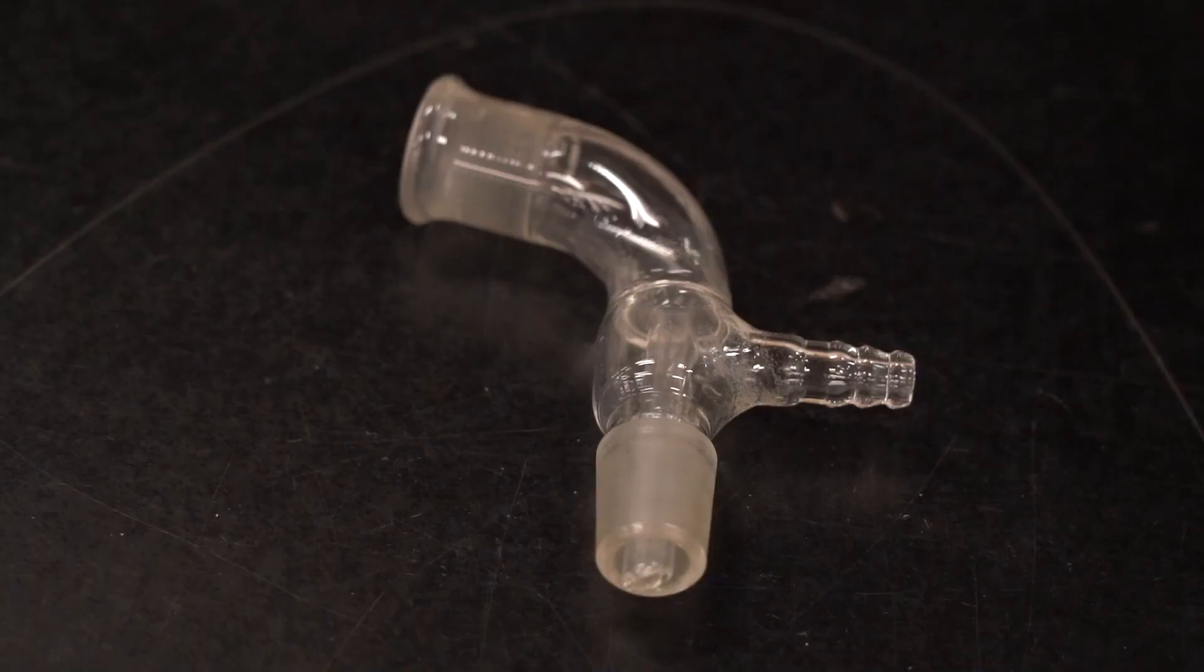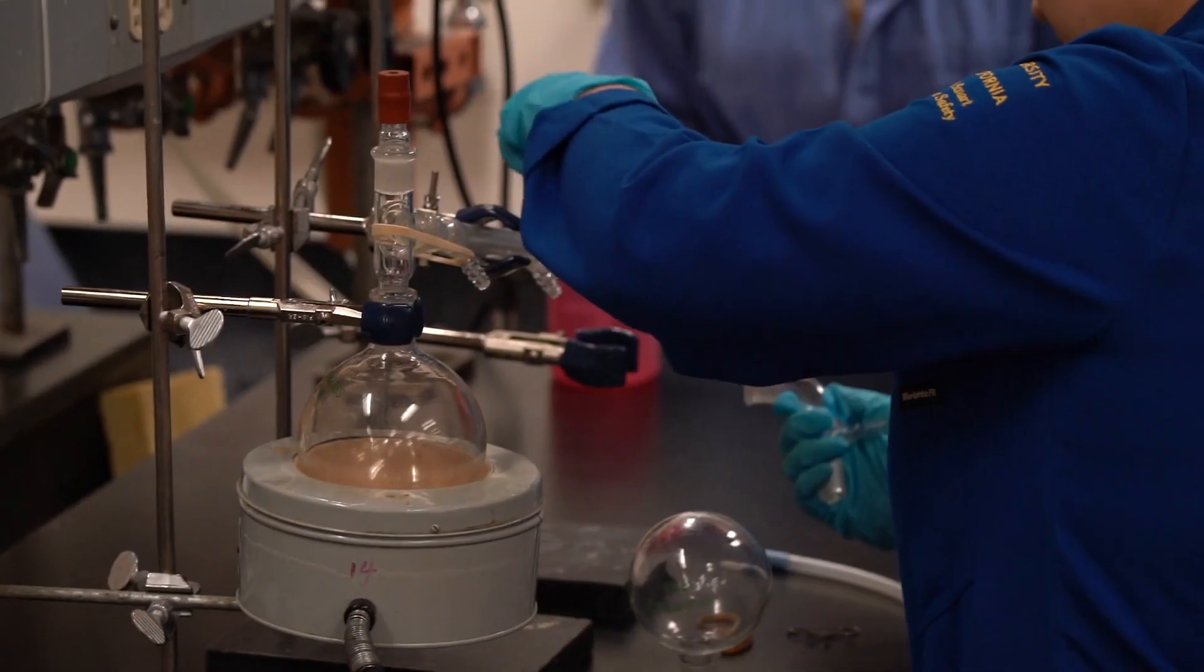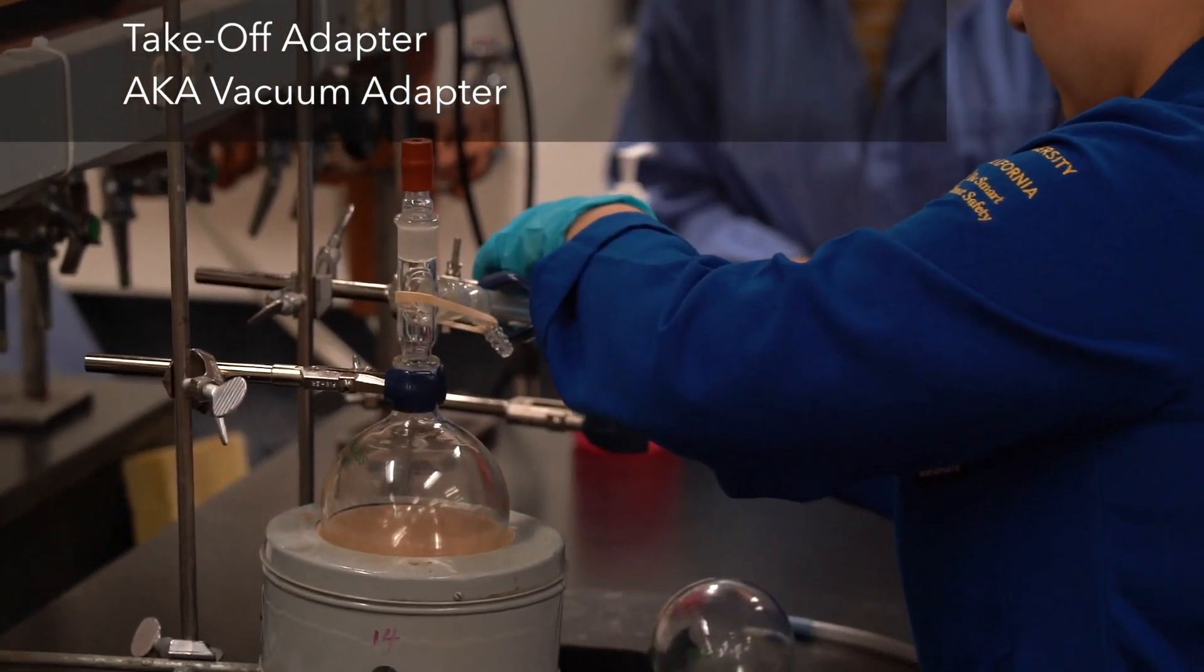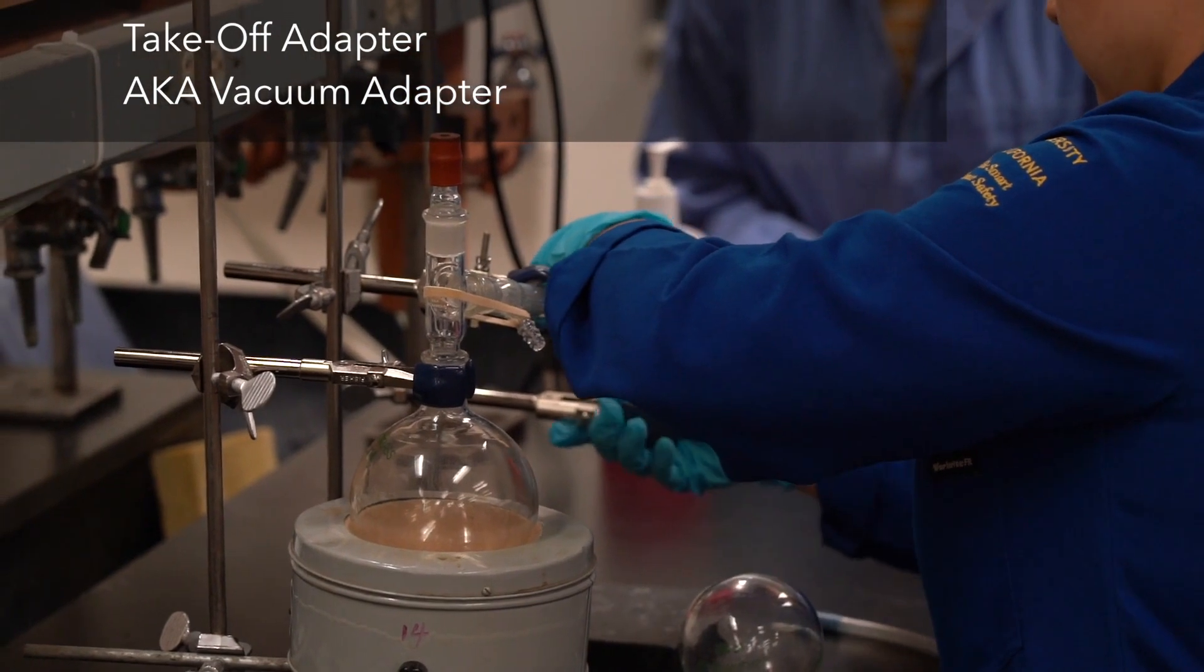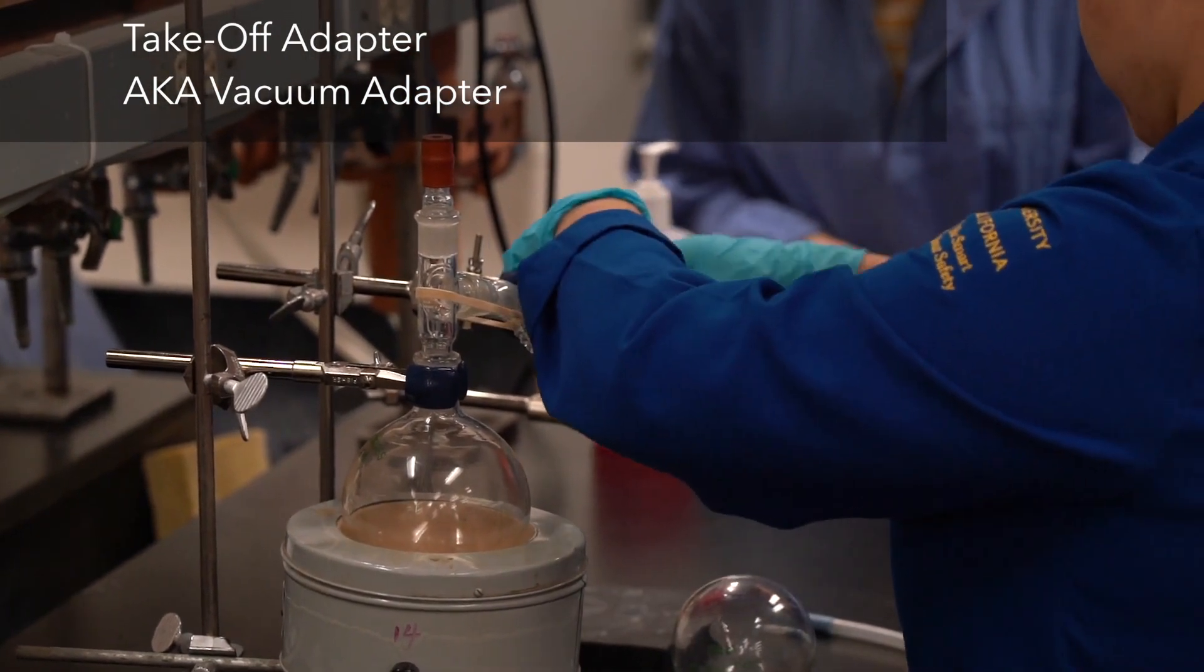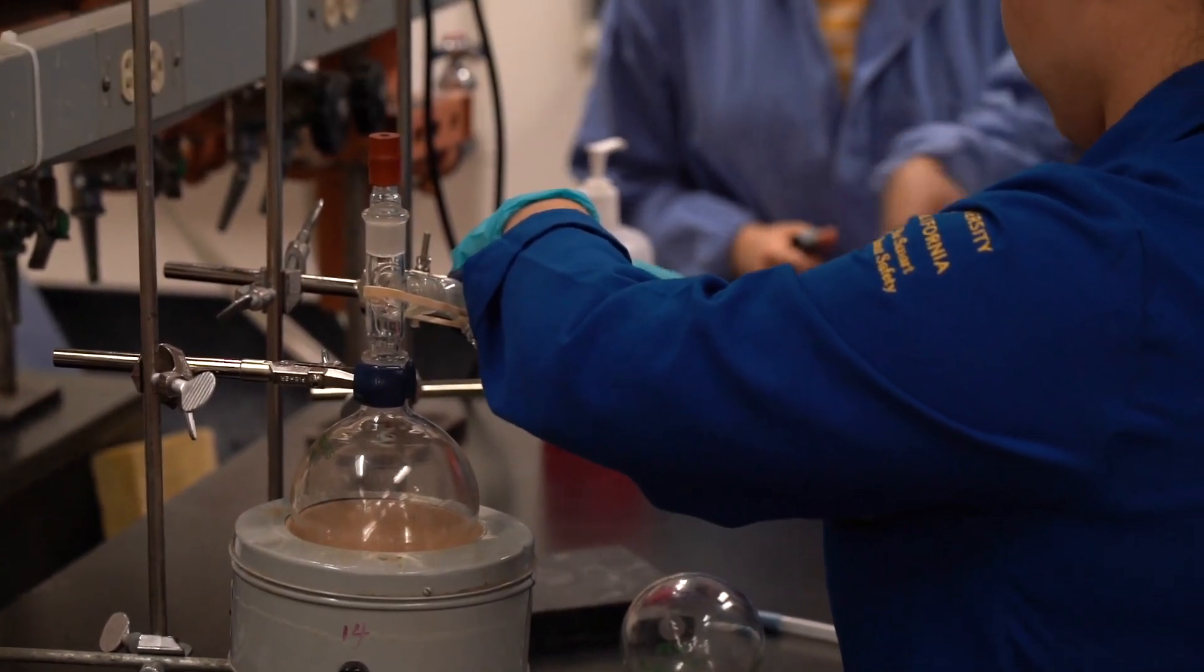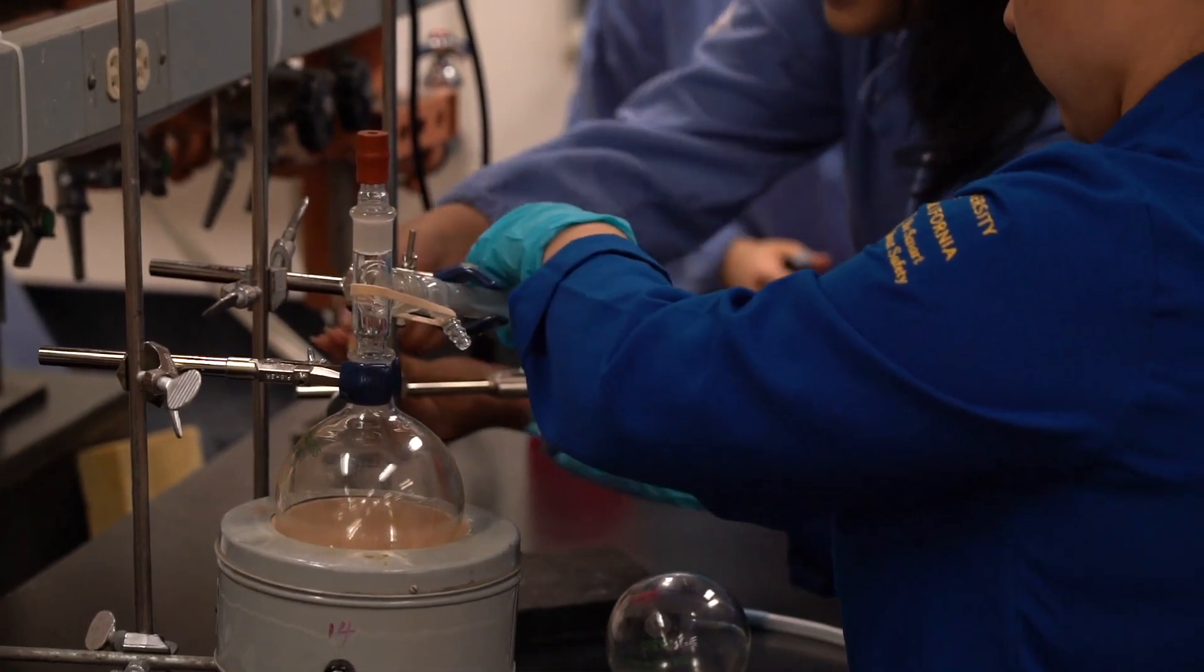And then we take more grease. Attach the other adapter. Can you lower this? Can you just lower this?